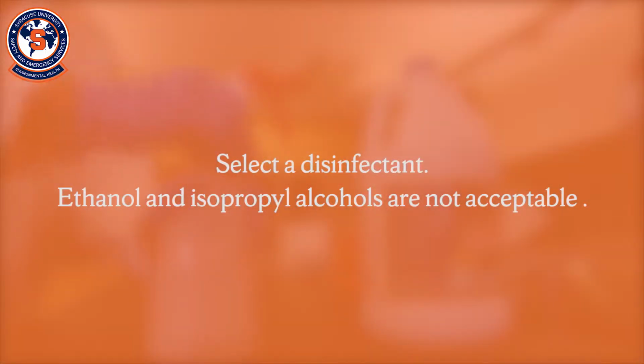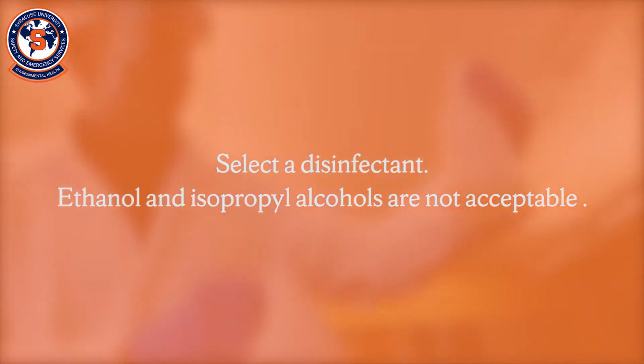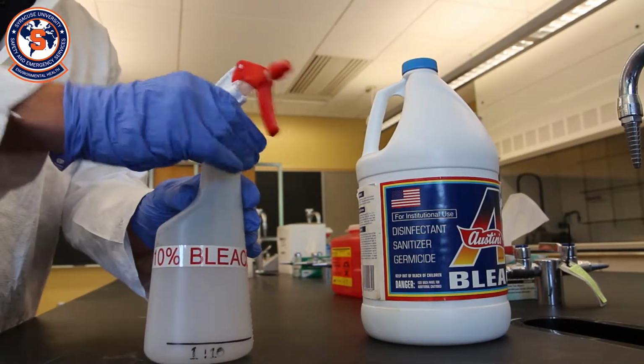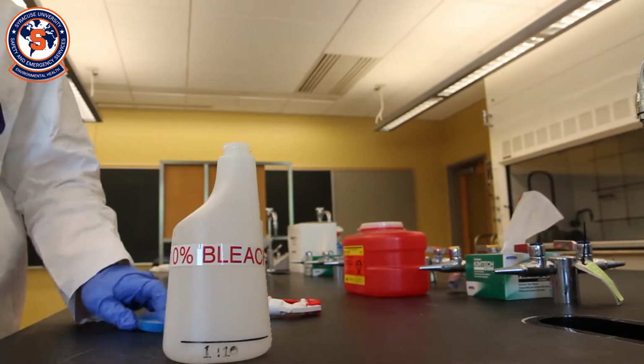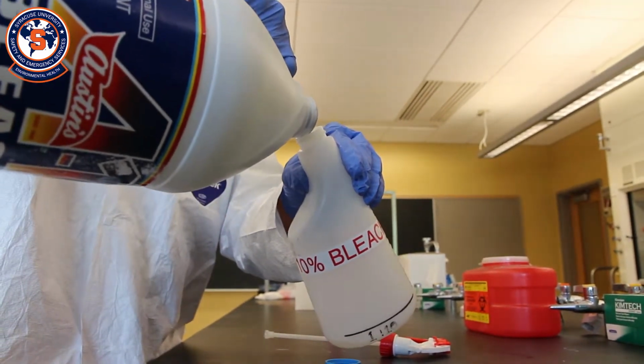Next, select a disinfectant that is effective at deactivating the infectious material you may be working with. Ethanol and isopropyl alcohols are not acceptable for disinfection of spills. Alcohols are considered antiseptics and should only be used to prep surfaces before experiments. A common disinfectant used in biological spills is household bleach. Using a 1 to 10 bleach to water solution can be an effective disinfectant if prepared fresh daily.